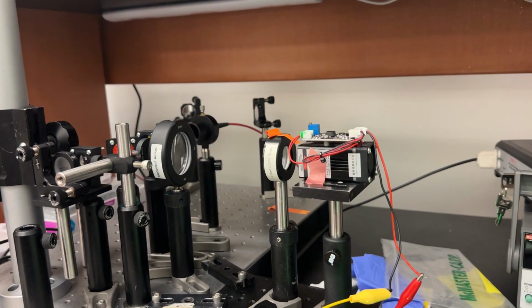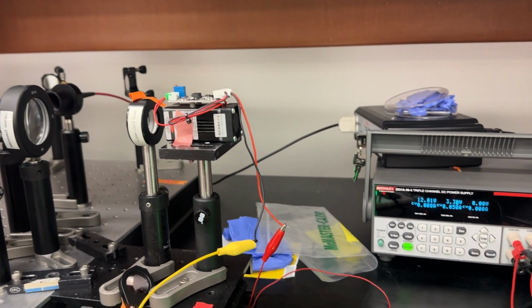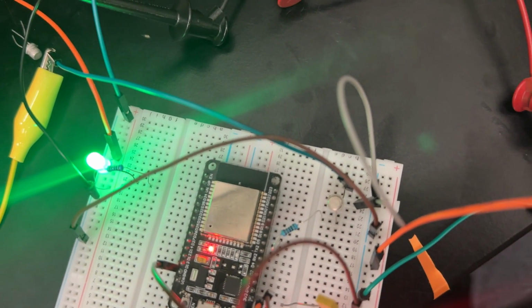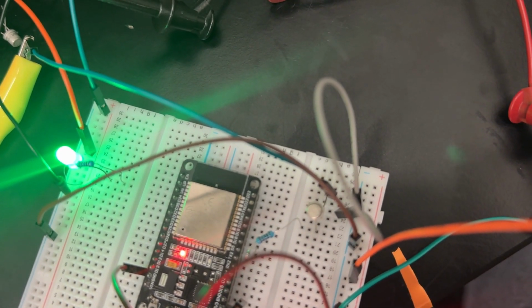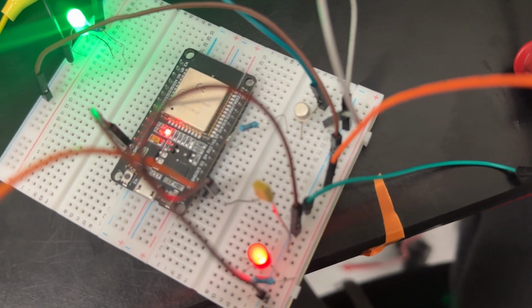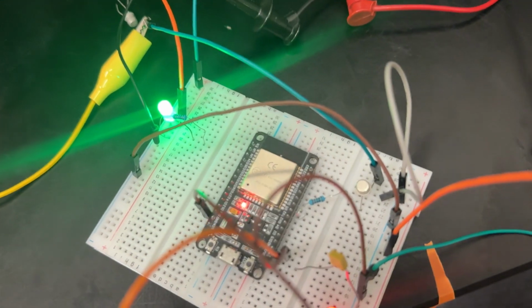Here we have the laser connected to the probe optics system, and it's currently being controlled, turning on and off every 2 seconds. Here's a circuit allowing it to do so. We have the ESP32 connected to a resistor at GPIO 18, which is connected to a transistor. And then we have the red LED indicating that the ESP32 is receiving the proper voltage, as well as the green LED indicating that the laser is receiving the proper voltage.